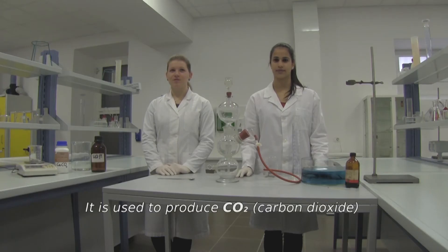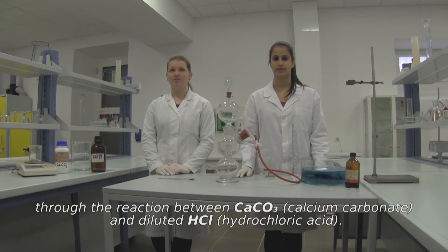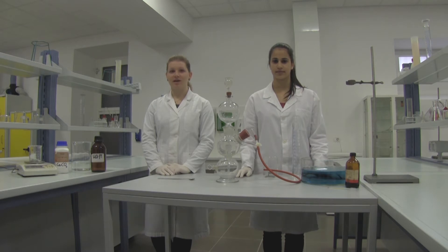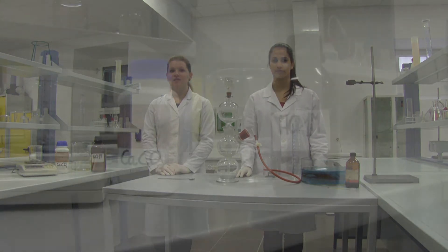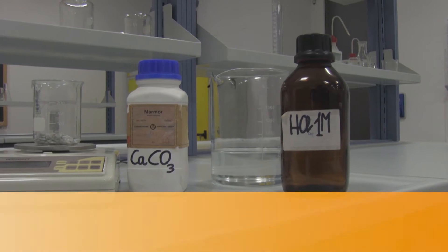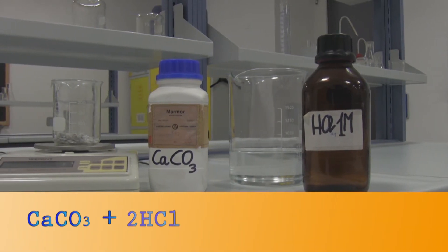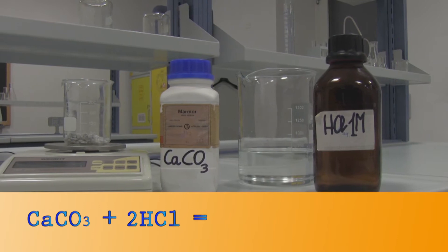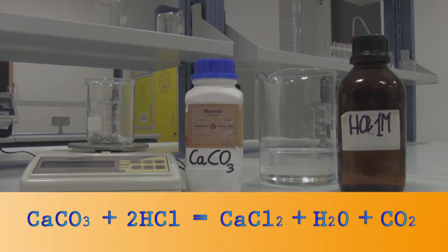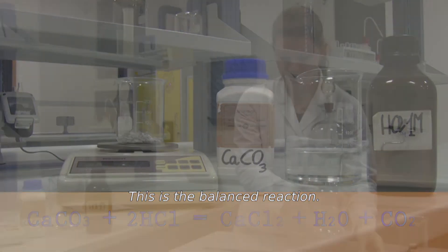It is used to produce carbon dioxide through the reaction between calcium carbonate and diluted hydrochloric acid. Calcium carbonate plus two moles of hydrochloric acid reacts to give calcium chloride plus water plus carbon dioxide in gaseous state — this is the balanced reaction.